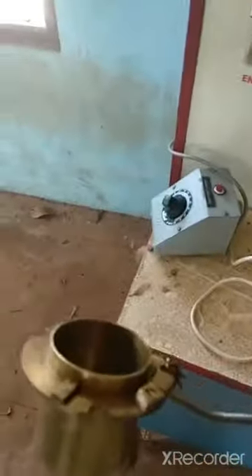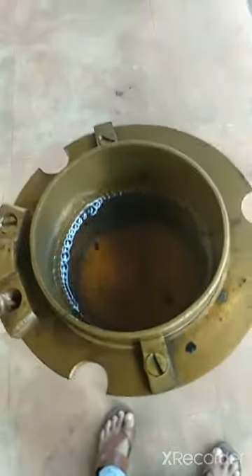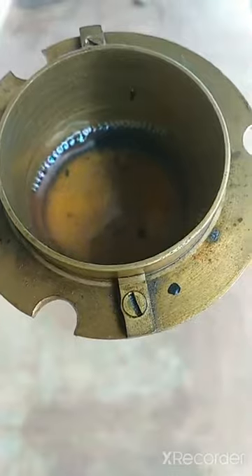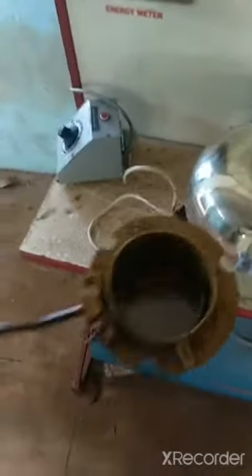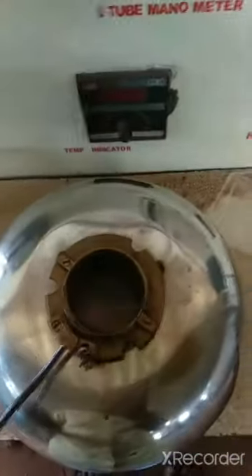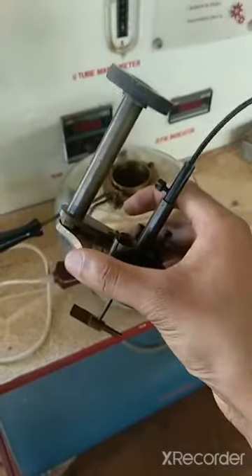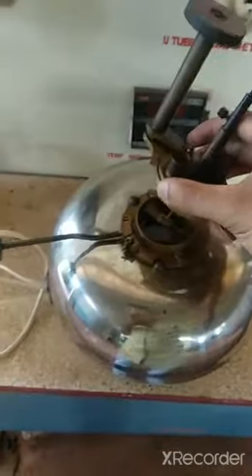In this cup, we have marked the markings for diesel. I am working on the markings here and putting the marking on the diesel. This is the diesel. I put the diesel on the heater. The pin is on the front of the device.